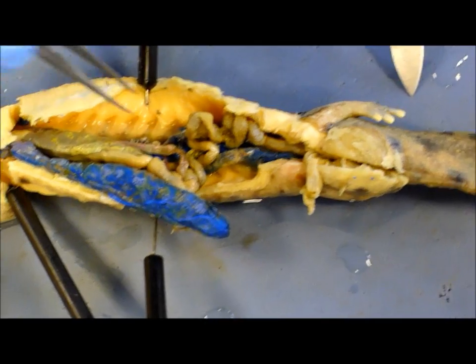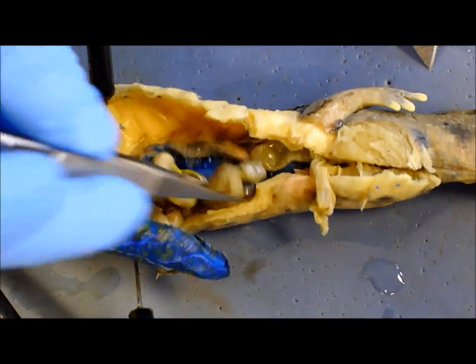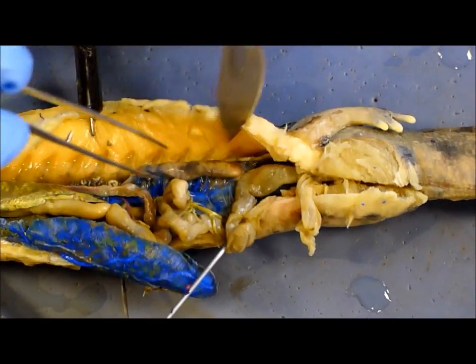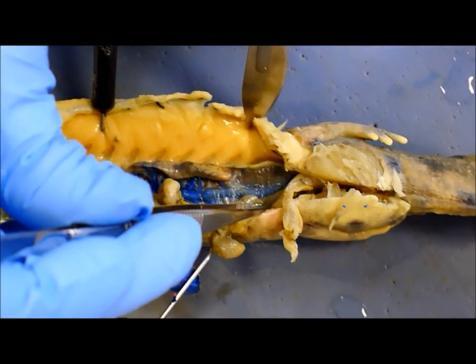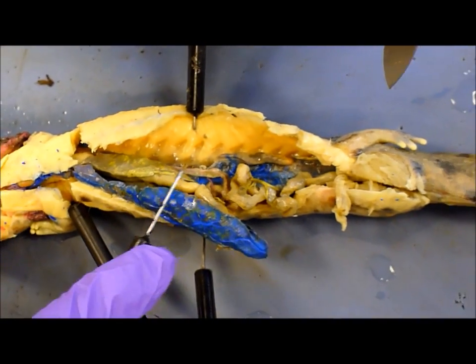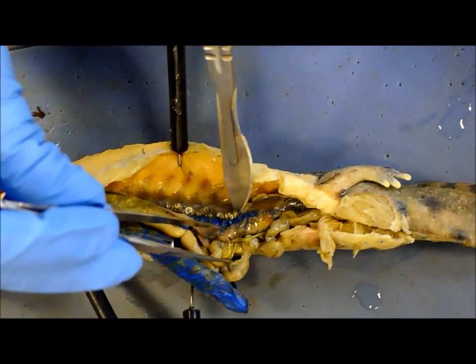Kidneys are way down in here — they look better on the other side, there's less blue. Testes — these little dark things right there. Archinephric duct — that swirly dooly thing.